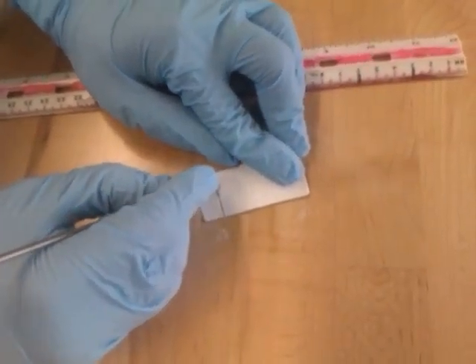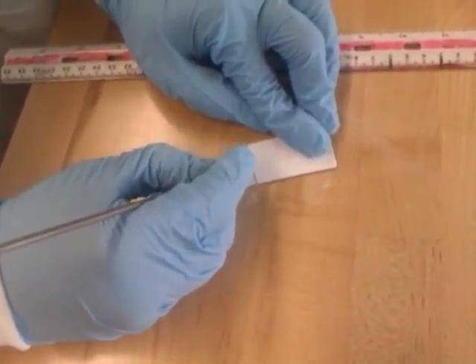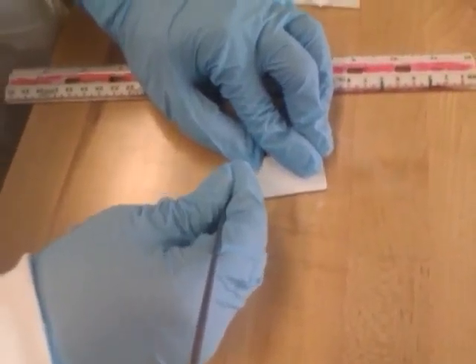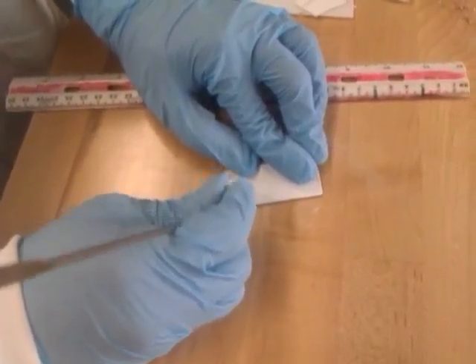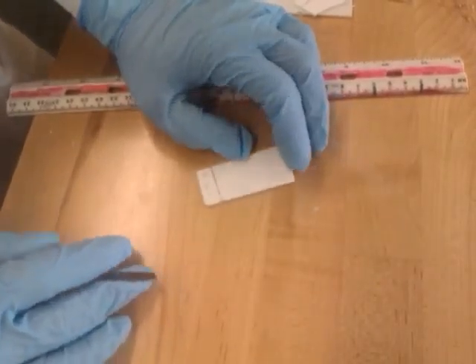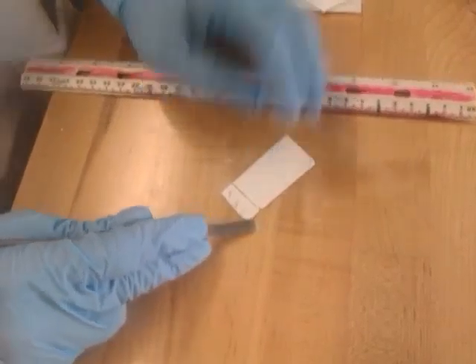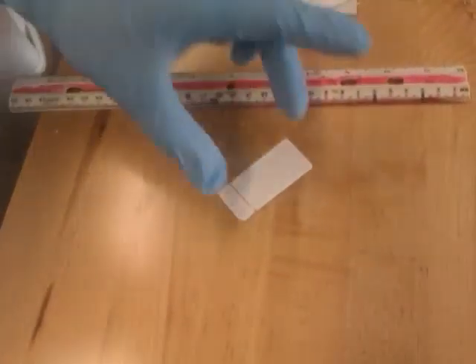Use the letter A for your first solution, B for your unknown, and C for your last solution. Those labels can run off the bottom, that doesn't matter. So you know A is your hexane, B is your unknown, and C is your water. Make sure you record that somewhere so you do not forget.